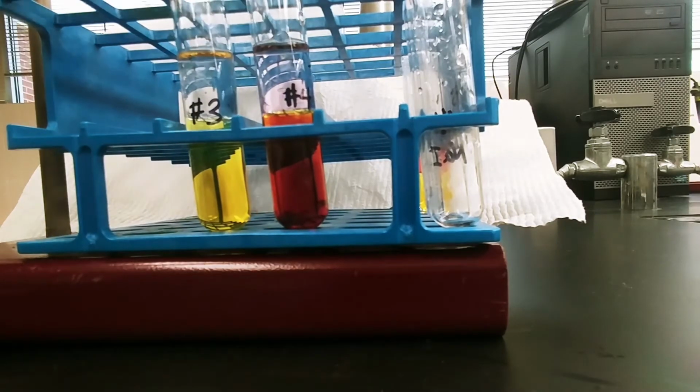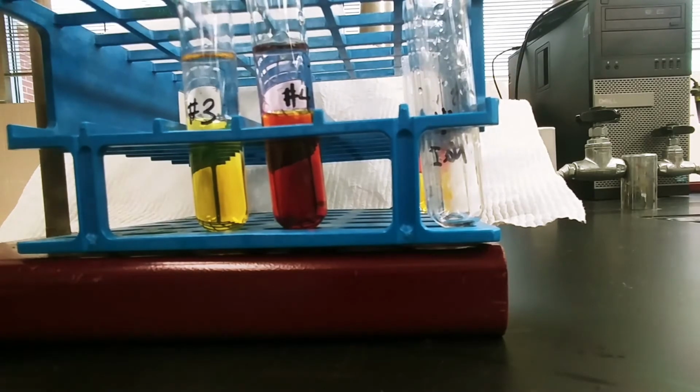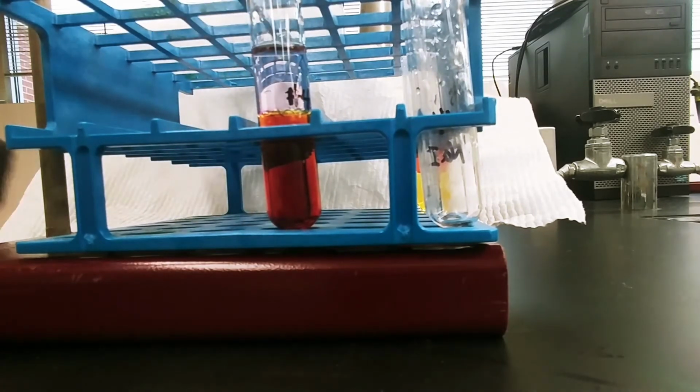So test tube number 3 currently has, what we've added to test tube number 3 is chlorine, diatomic chlorine, and bromide. Those are the 2 halogens in there initially and in what forms they are. We are going to see if chlorine gets pulled into the cyclohexane or if bromine gets pulled into the cyclohexane, meaning that a redox reaction would have taken place. So in order for there to be bromine present, the chlorine must be displacing the bromine.